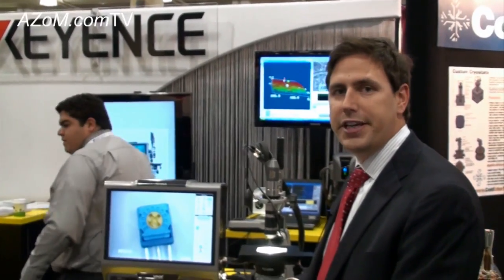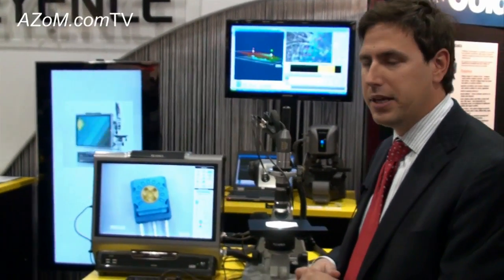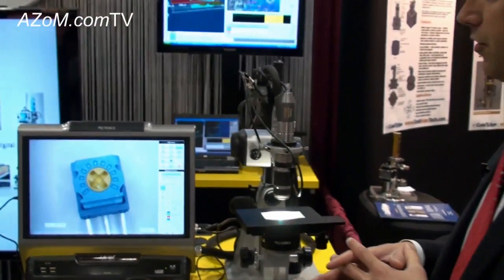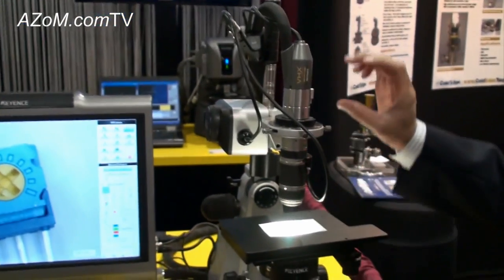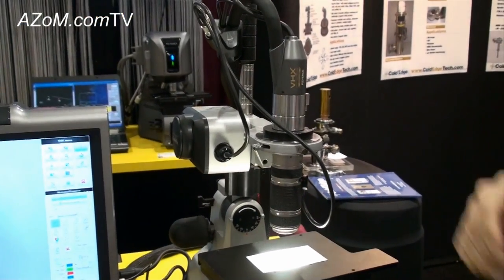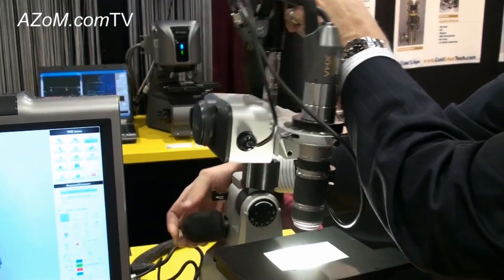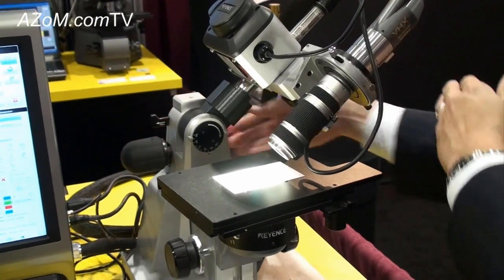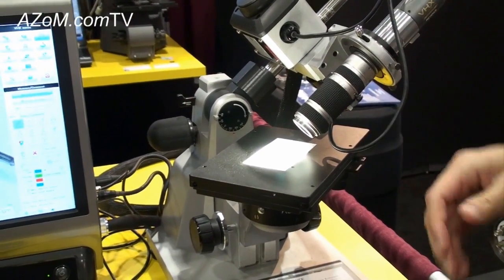What we have here is a fully integrated digital microscope system. The idea behind the device is that it has an optical system designed specifically for the CCD. It opens the door to some unique observation — for example, we have significantly larger depth of field than traditional optical microscope systems.